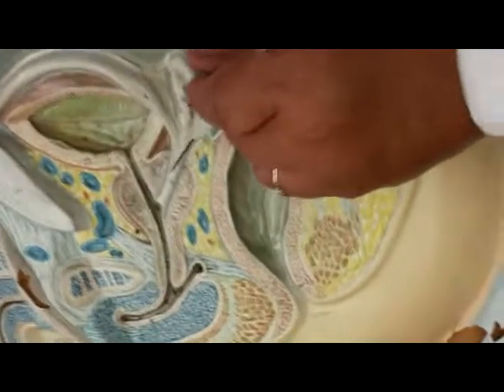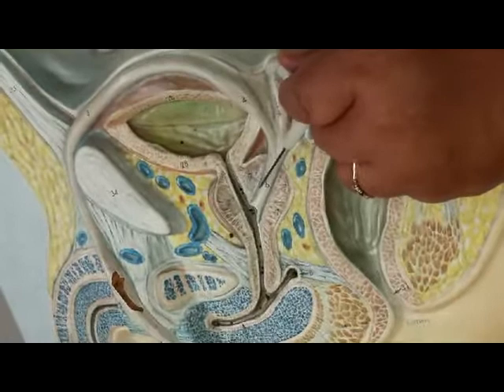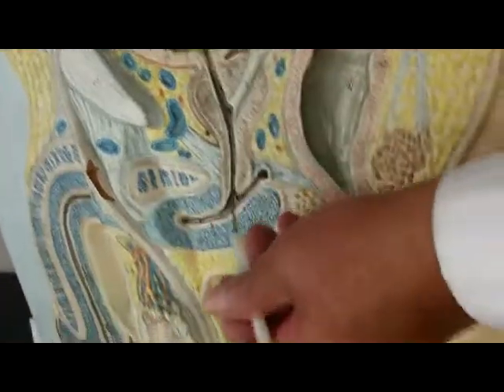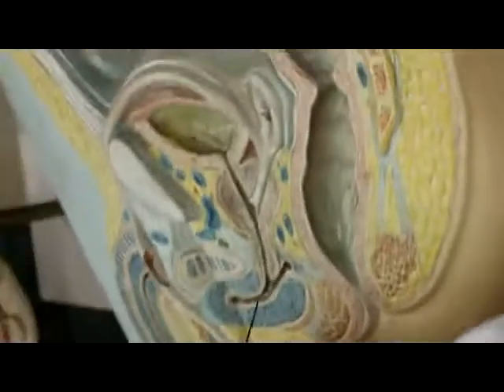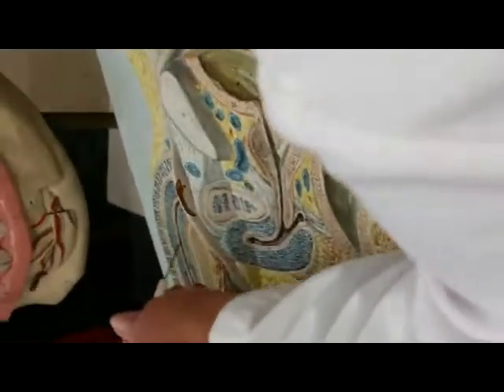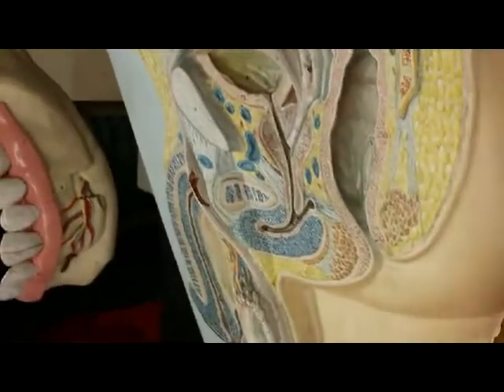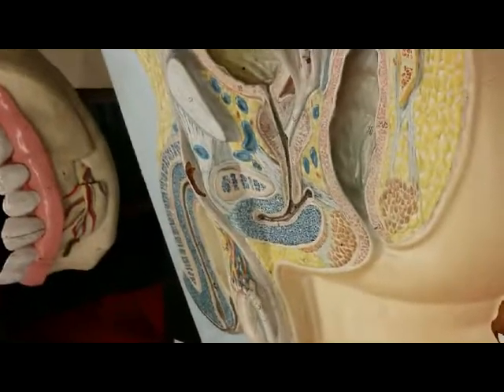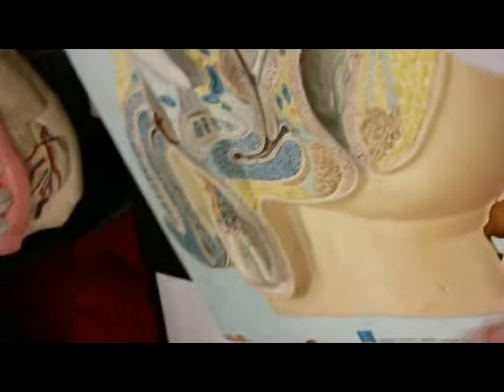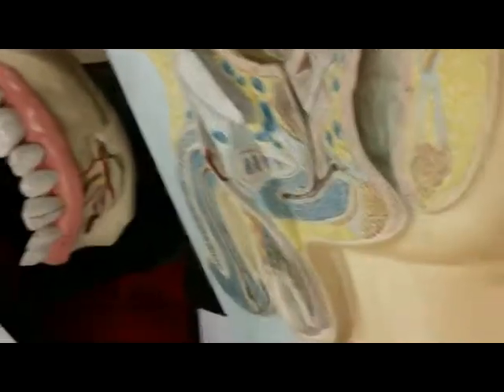And so now this carries the sperm and the semen, and this is the ejaculatory duct that's going to empty everything through what? What is this tube? That goes through the prostate gland, through the penis, and carries everything to the outside of the body. What is the tube? Can't be the ureter. Urethra. The male has a very long urethra. That's why they have no problem with UTI.